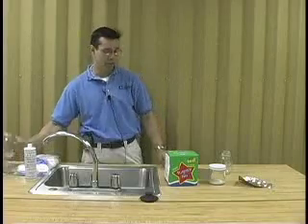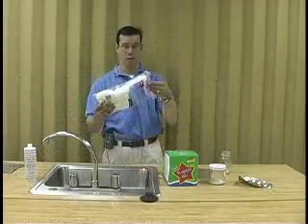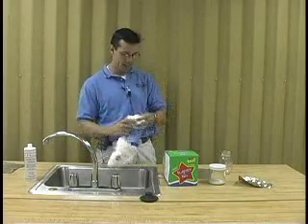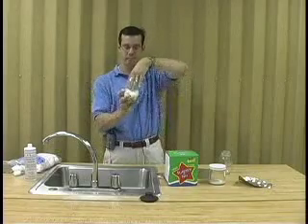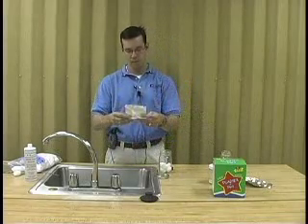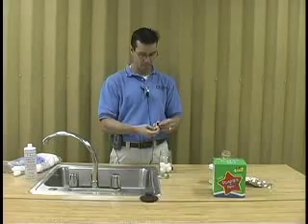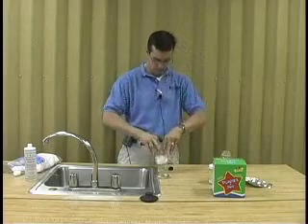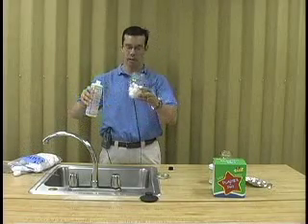Now another method that can be used is you can use the same mason jar. What you do is purchase some cotton balls from the same retail store. Place 4 to 5 cotton balls in the bottom of the jar, such as you see here. Place a piece of aluminum foil or paper on top of the cotton balls, such as you see here. Charged with acetone. The acetone will soak into the cotton balls.